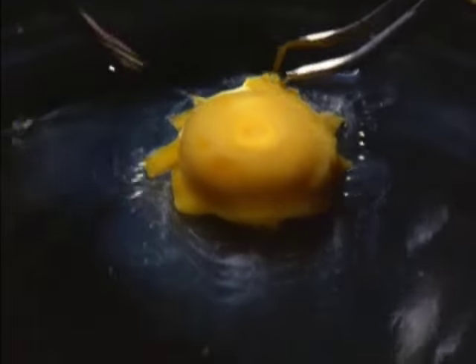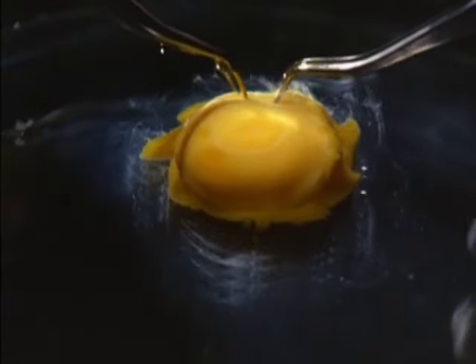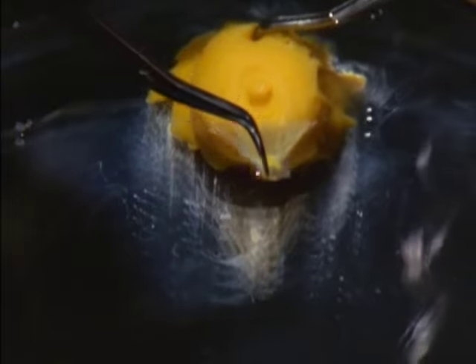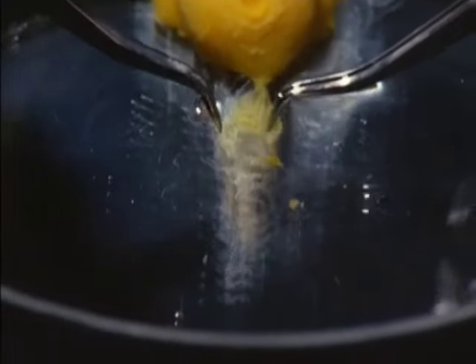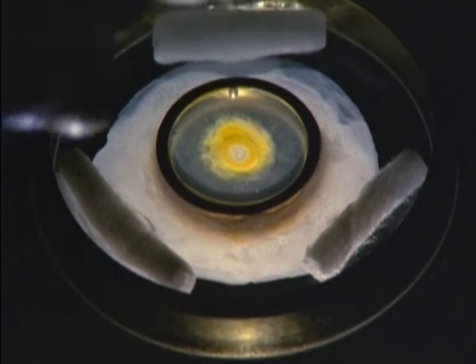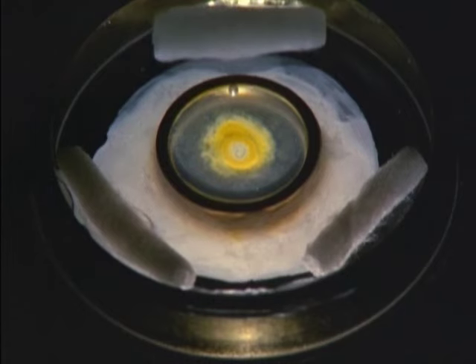It's a mass of cells which have already multiplied from a single egg cell following fertilization. The blastodisc is now removed along with the thin membrane wrapping the yolk in order to be cultivated with artificial nutrients. The blastodisc is placed in the culture fluid inside out to facilitate observation. This film closely studies the intricate processes of the embryonic development of a chicken.